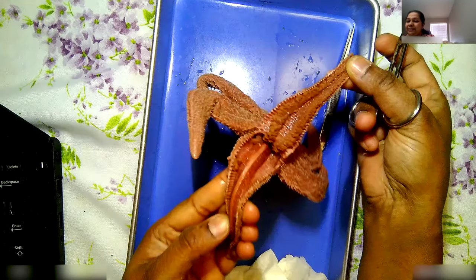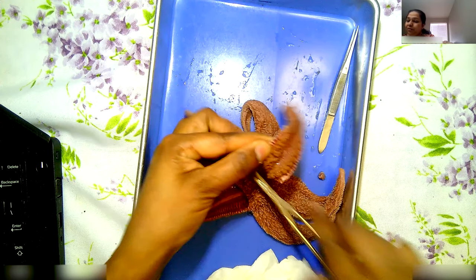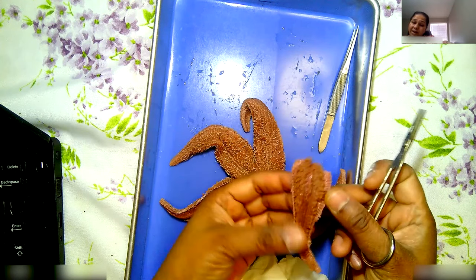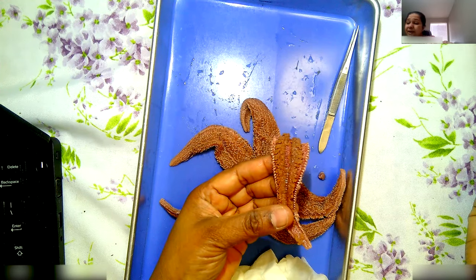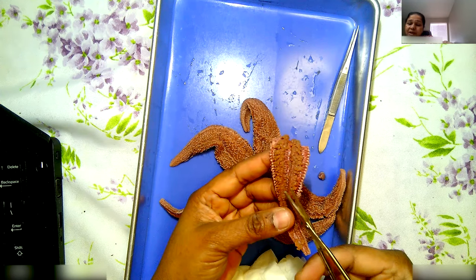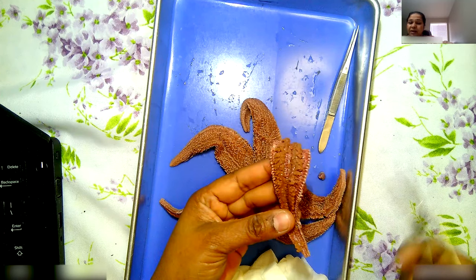When I opened it up — see this — that is the digestive glands. Whatever you see on top is the digestive glands. I'm going to cut that and show you. These are the digestive glands — they're smooth, you touch it and it's smooth. These are the digestive glands that help in secreting the enzymes that go into the stomach. We cannot tell the difference between female or male starfish from the outside. When they're ready to release eggs or sperm, we can see another structure by these glands, but we don't see it here — this is not the time. These are the pyloric cecae that secrete the enzymes for the food to be digested.